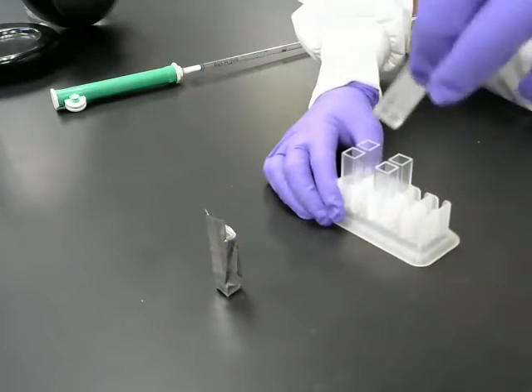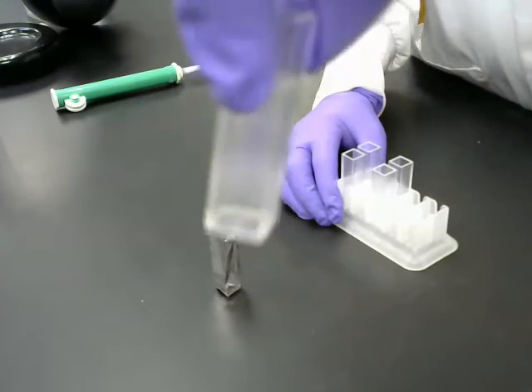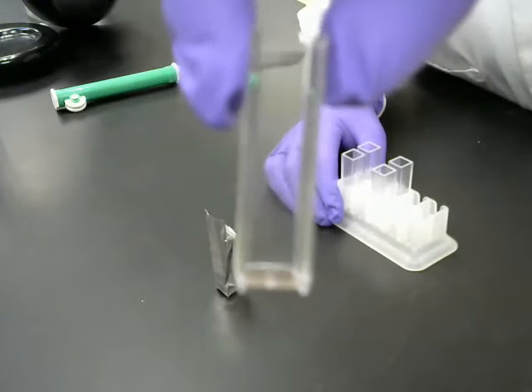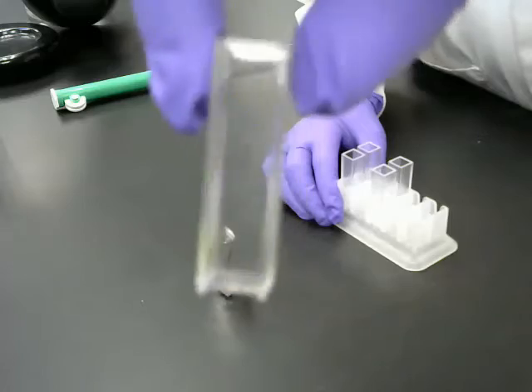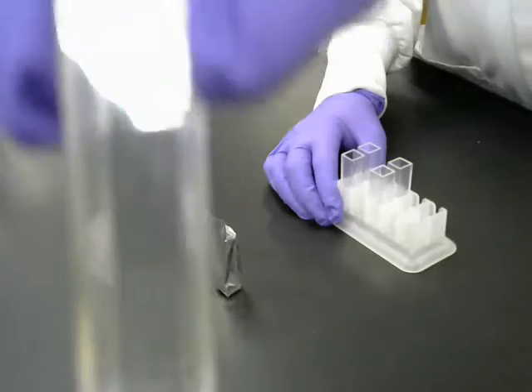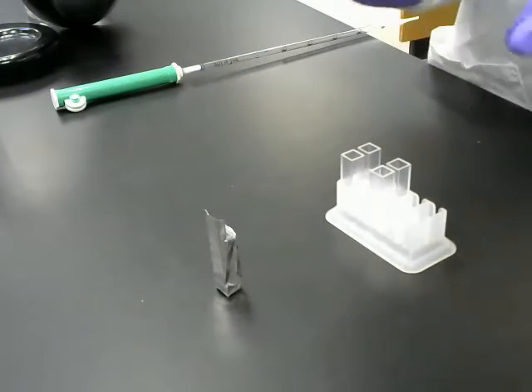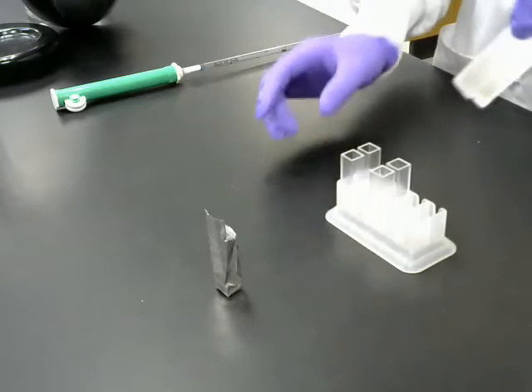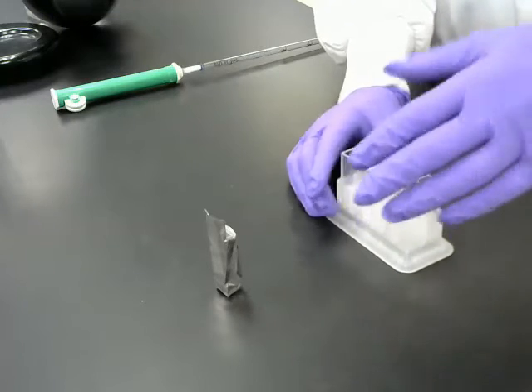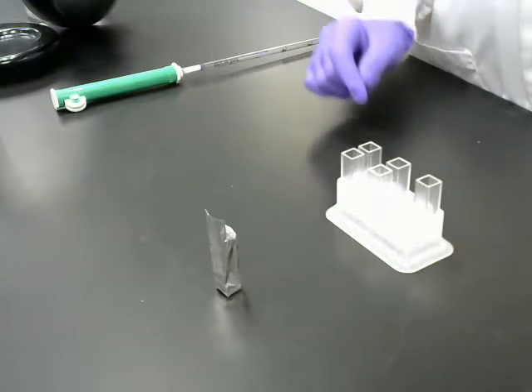To show you these cuvettes, they are cubic, so they're not the low volume cuvettes that we used in our chlorophyll assay. You'll notice that two sides are ribbed. Those are the sides that you can touch, and then 2 sides are clear, and that's for the light path. So we make sure that we don't get fingerprints or other kinds of crud on the sides where the light is going to shine through. I have a total of 6 cuvettes set up here. Like I said, that one wrapped in foil is going to be our dark control, and we'll talk about that in a minute.